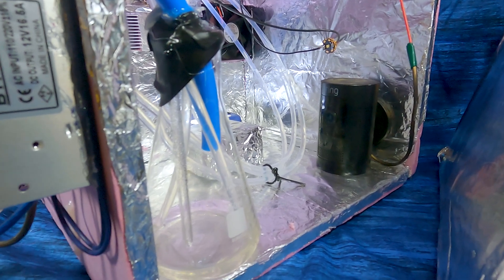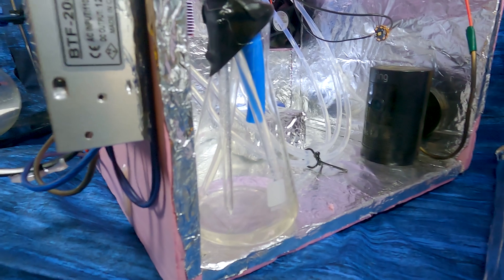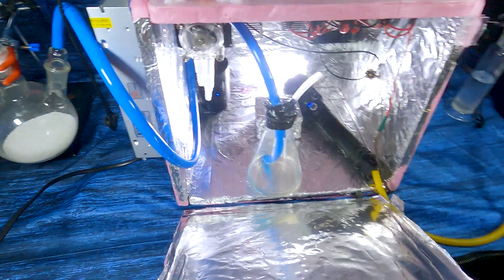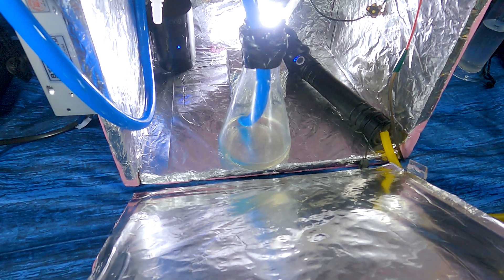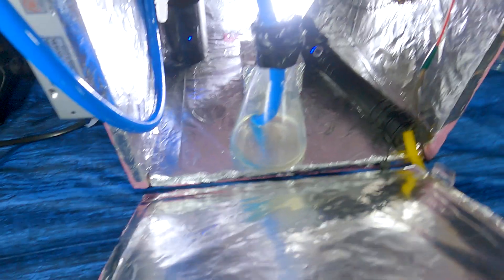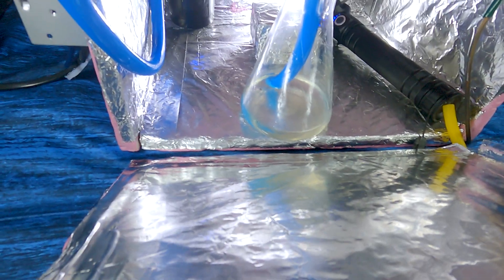So with that, let's turn it on and get the flow reactor started up, and we'll see what happens. Okay, so things happened — we didn't even get started yet. The chloroform got very angry at the material I used for the tube going down to deliver the chlorine, and it melted it. So now we're using TPU tubing to go down and deliver the chlorine, and FEP tubing to go out to the scrubber.